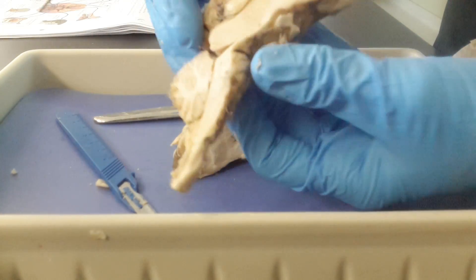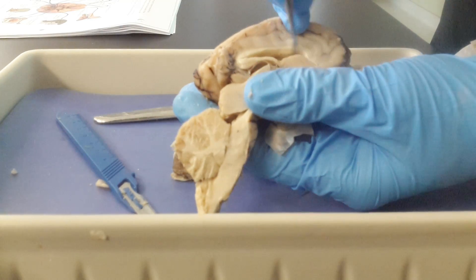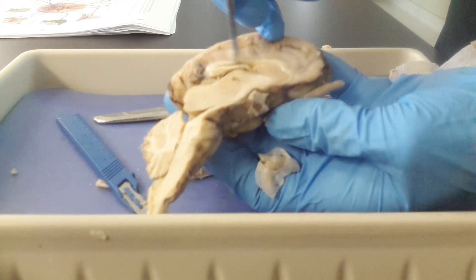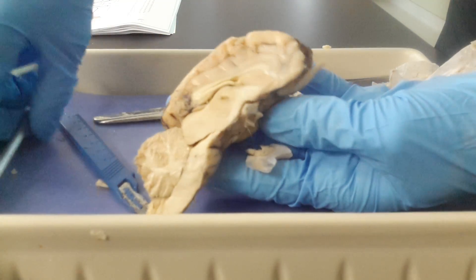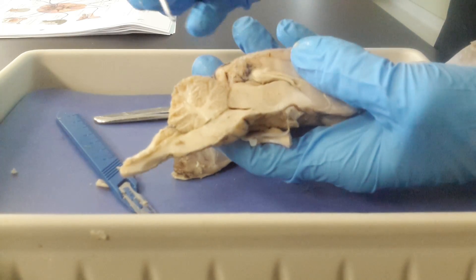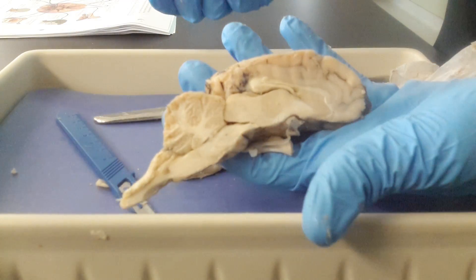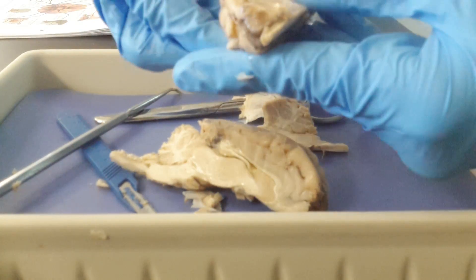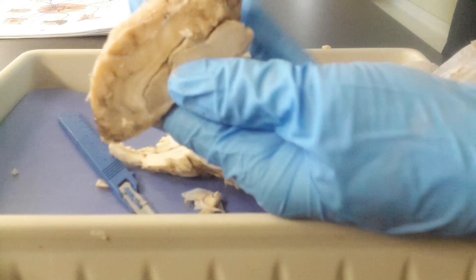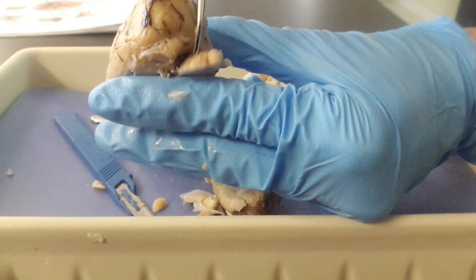When we look up here in the superior part of the brain, we can see this large open space right here. This is showing you the lateral ventricle. Also, as we move down to the brain stem, we have the midbrain, then the pons, then the medulla oblongata, and finally the spinal cord. On the other half again, we see our lateral ventricle, and you can still see the superior colliculus and the inferior colliculus.